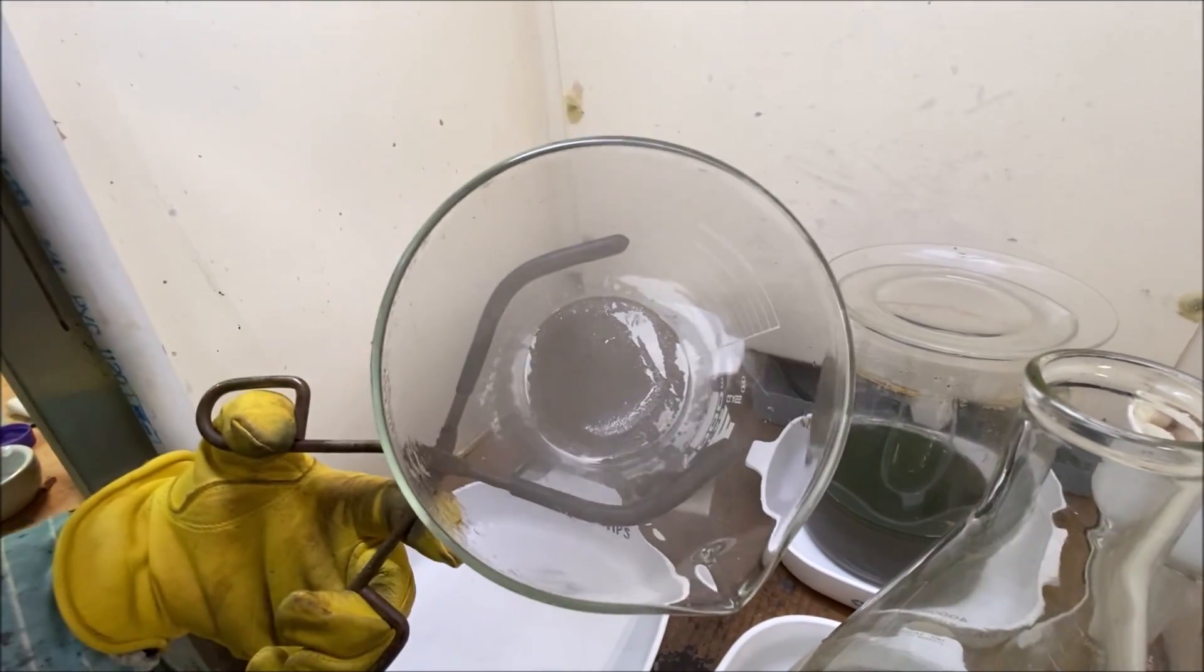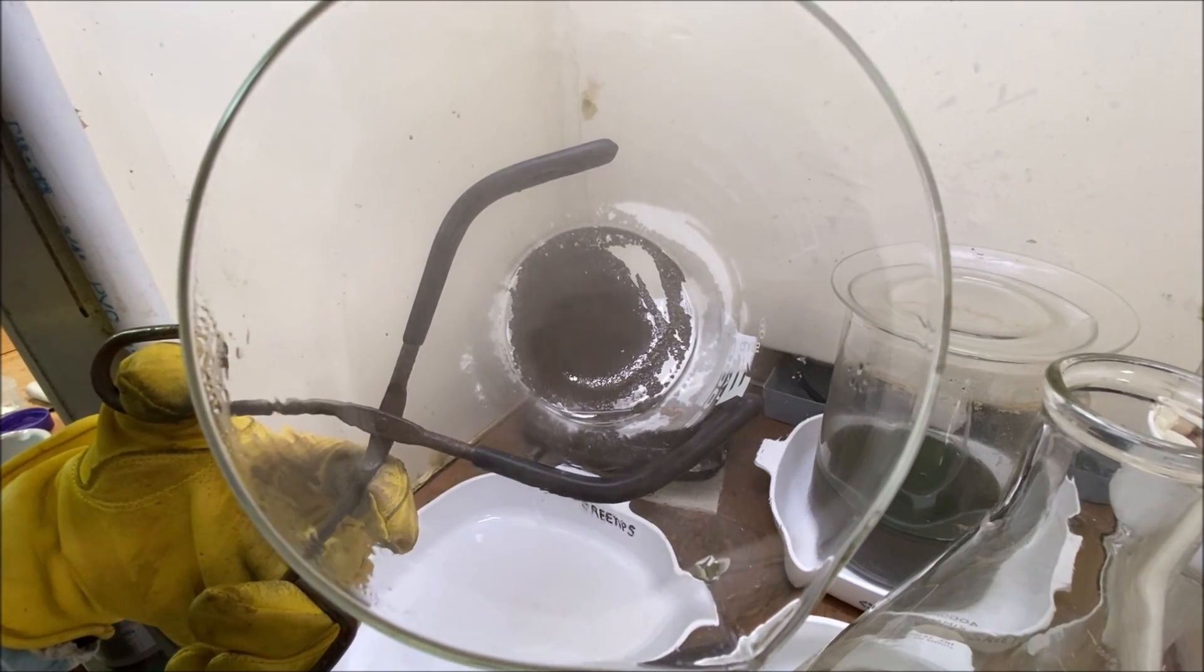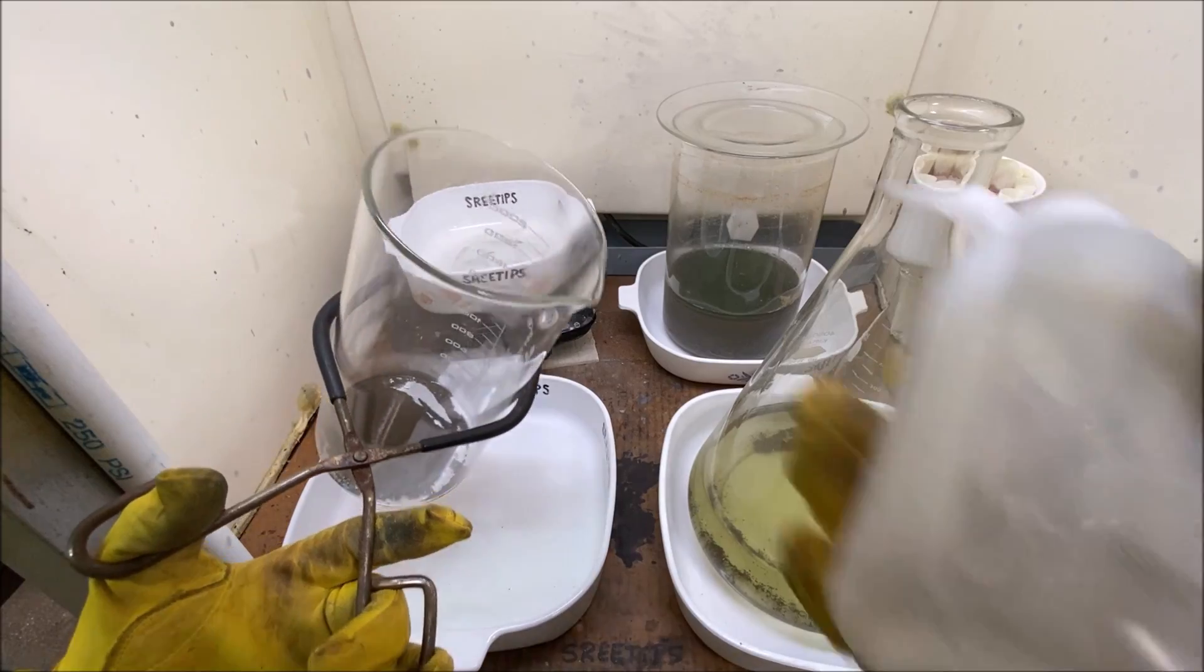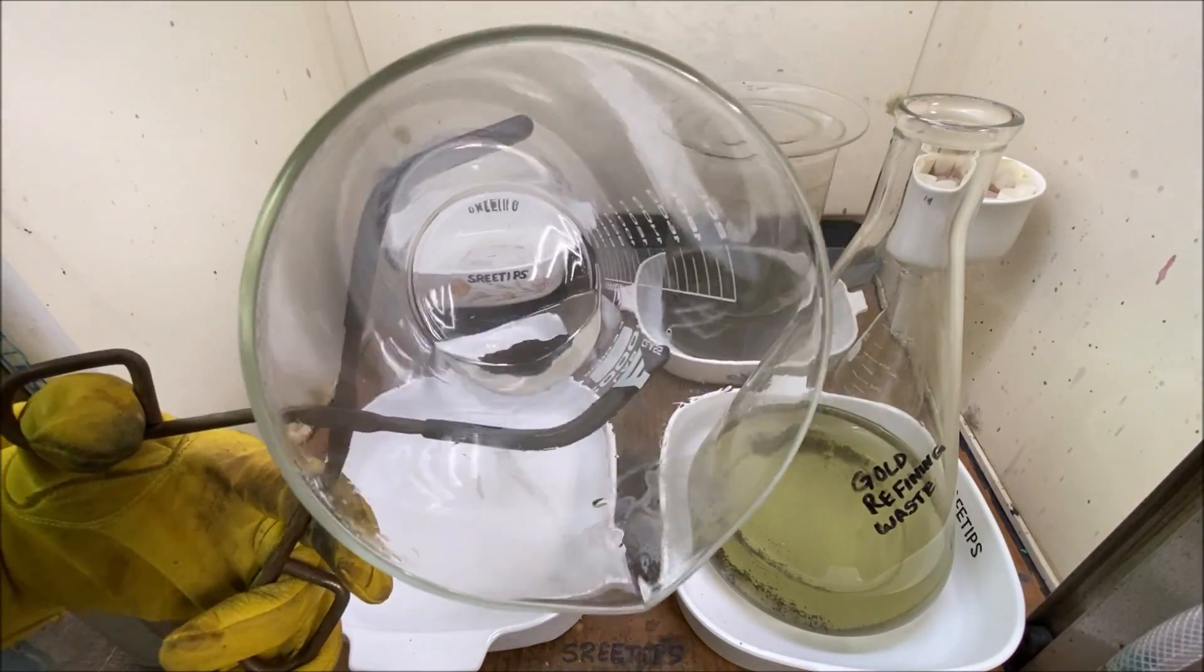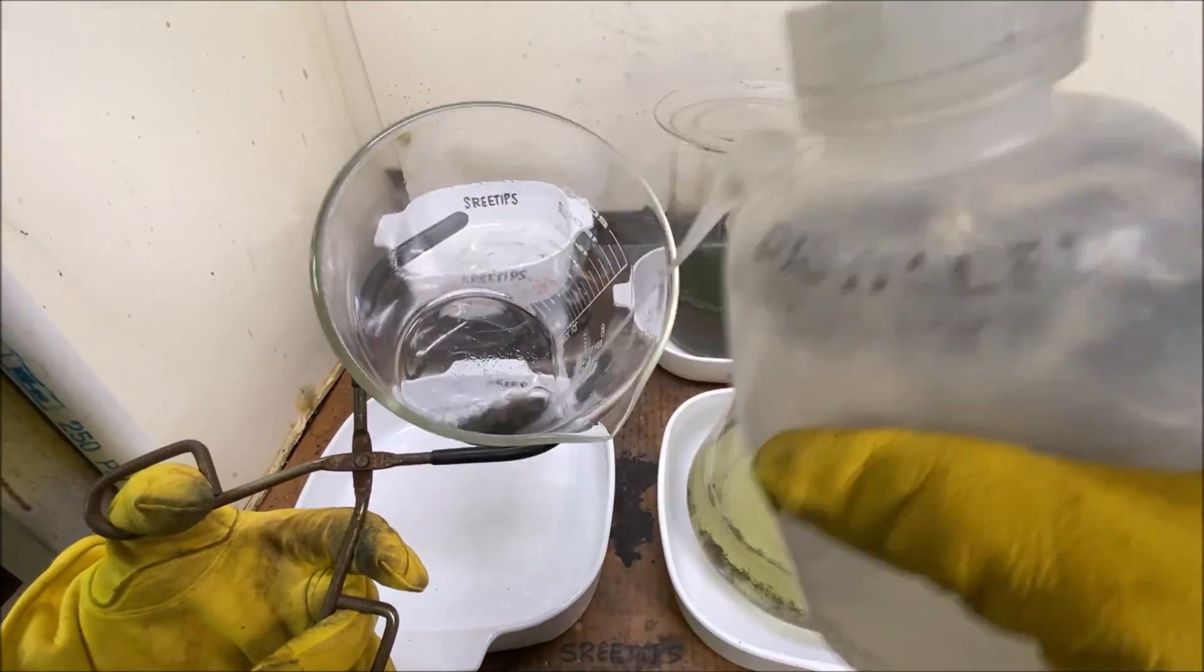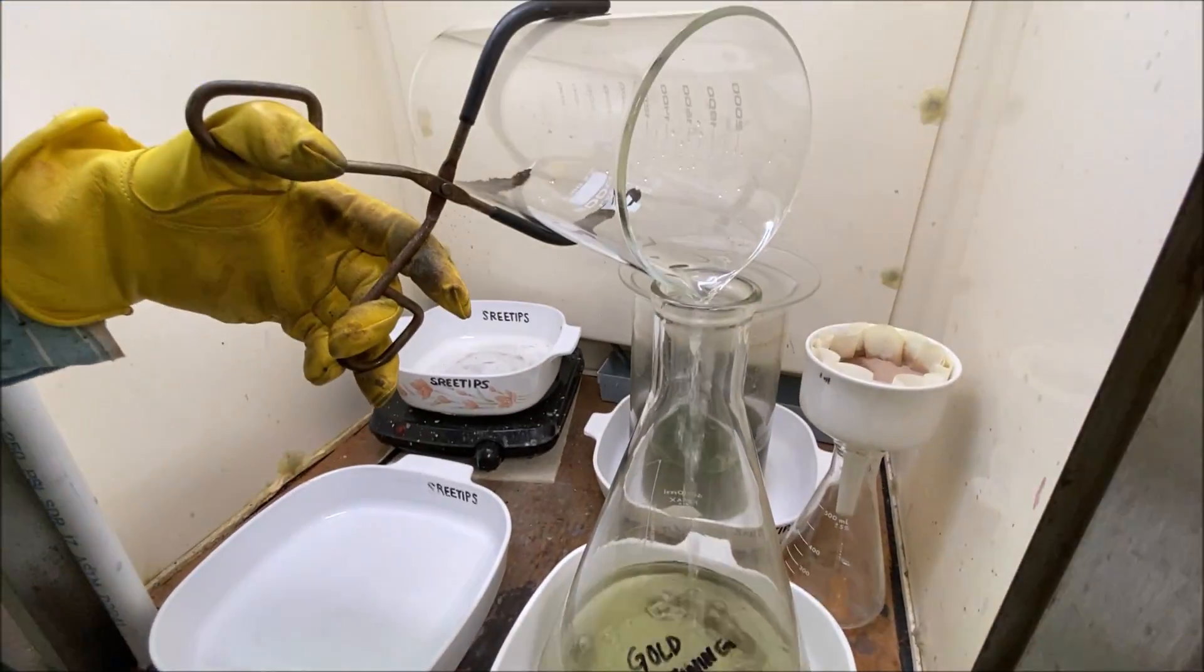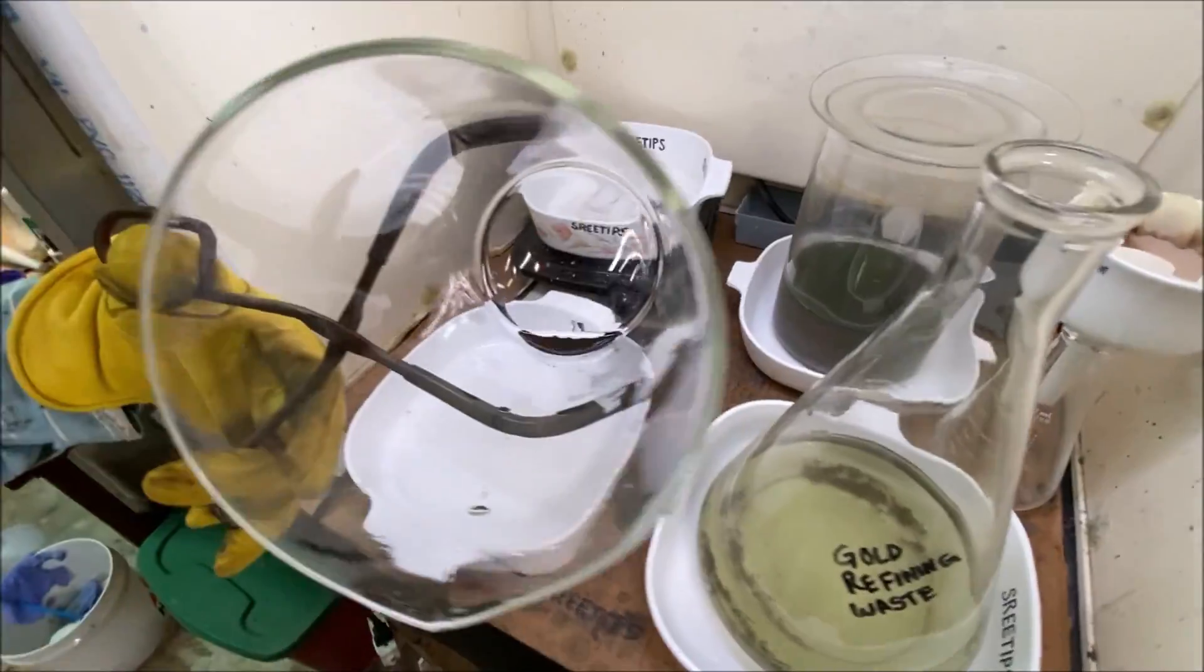Now we're just going to go ahead and pour this off into our waste container. All right, here's our gold down in the bottom of our beaker. Let's give this a rinse with some water.